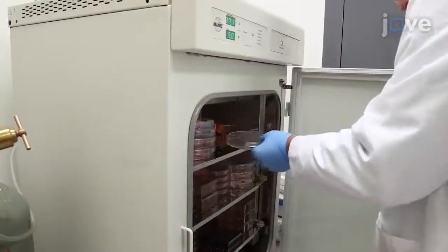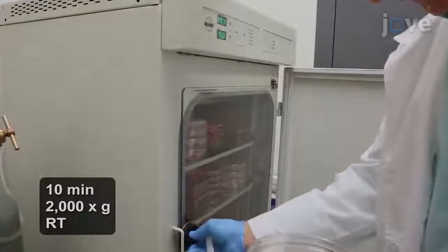It is essential that the incubation of the bacteria and the endothelial cells occur for an appropriate length of time. If the incubation is too short, the amyloids will not be released into the supernatant. If the incubation is too long, the cells will actually lyse and release all of their contents into the supernatant. The indicator that we use for an appropriate duration of incubation is the formation of gaps in the endothelial monolayer. When gaps can be observed in the cell monolayer by light microscopy, harvest the supernatant for centrifugation to remove any cellular debris.